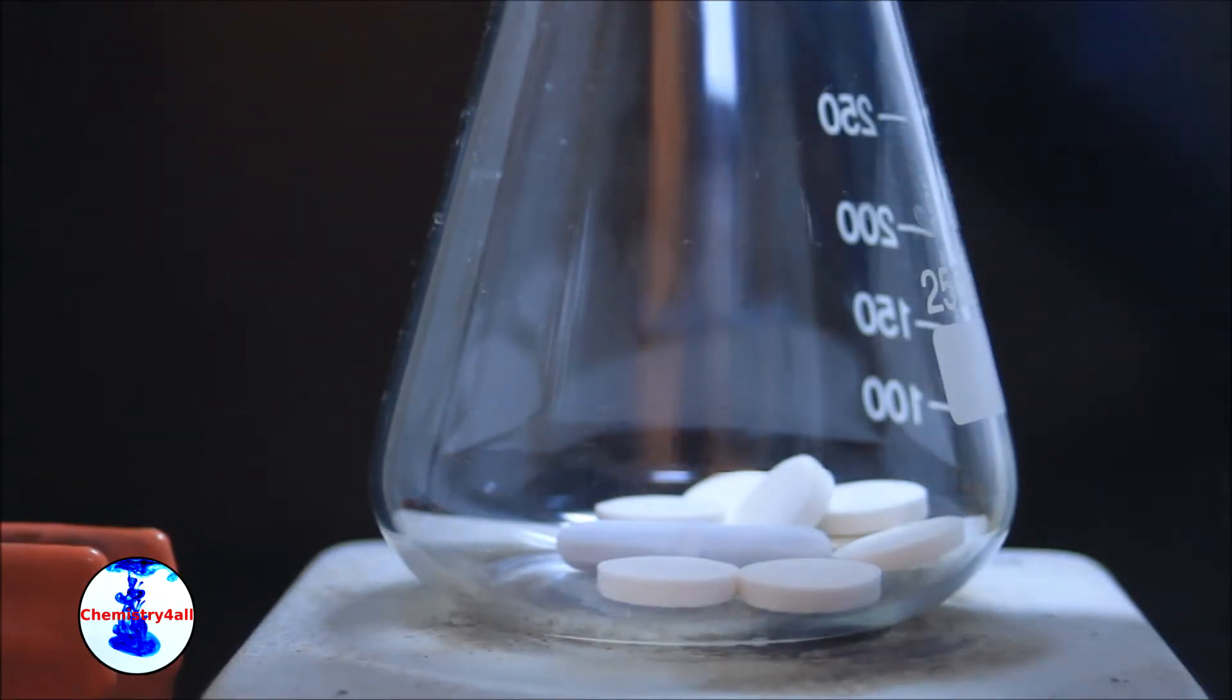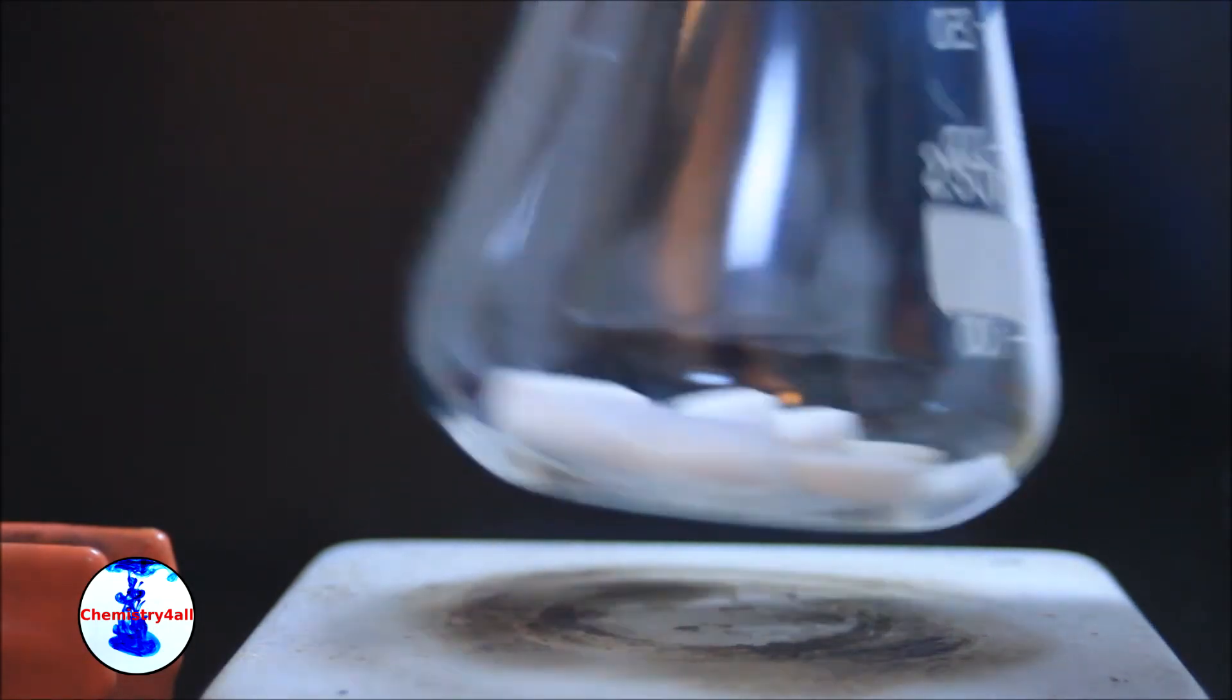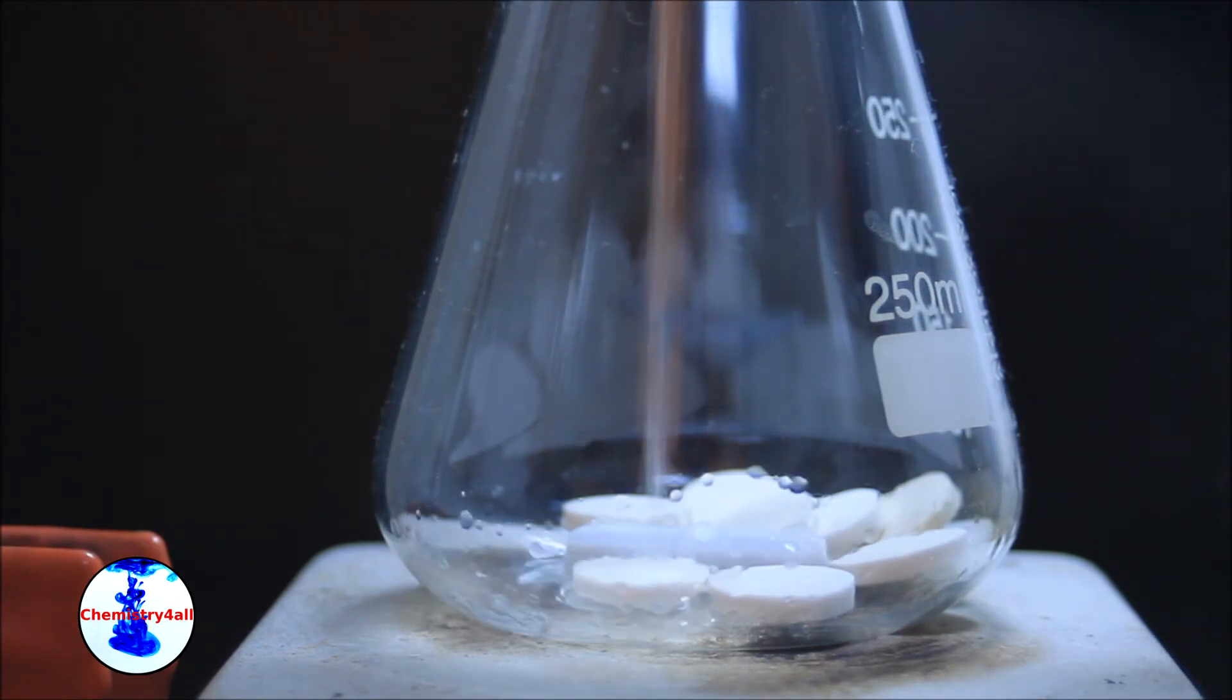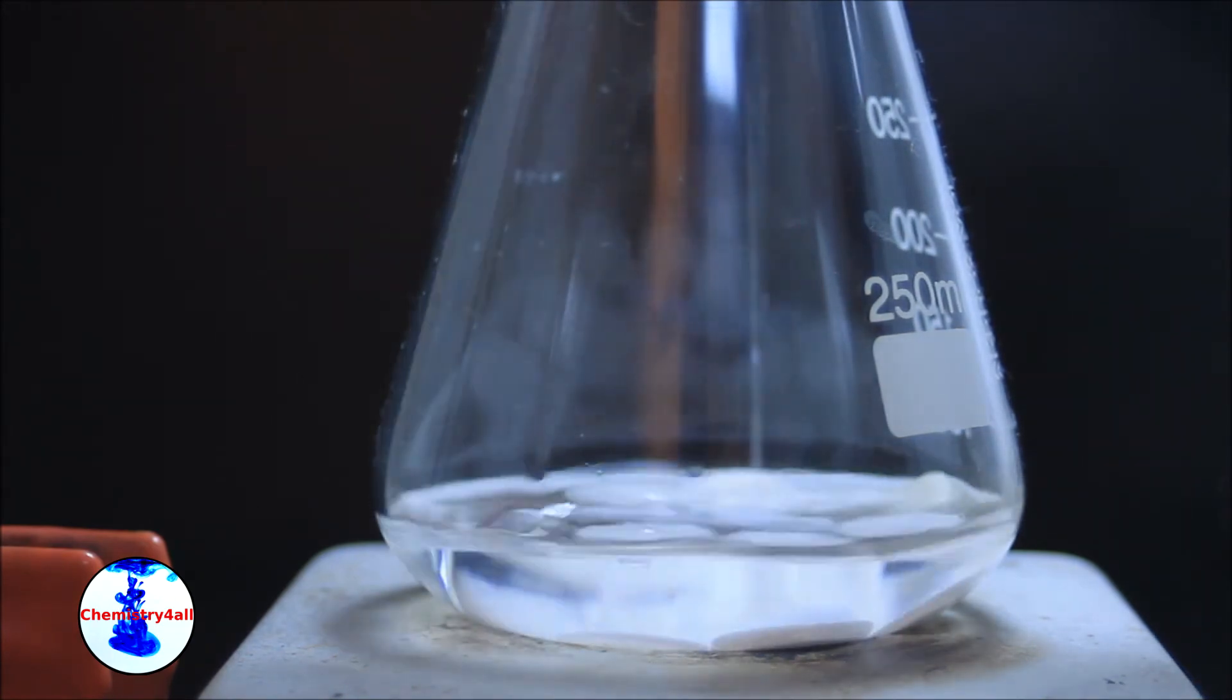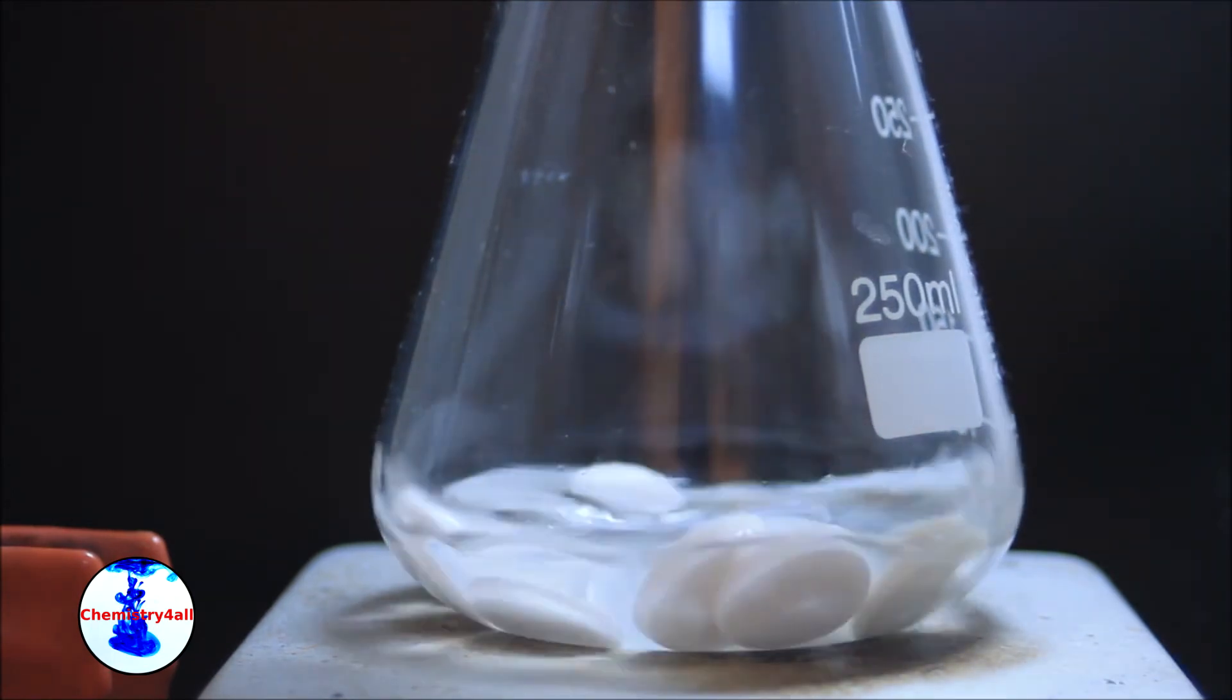In the meantime, I decided to carry out a second extraction using another 17 grams of pills, but this time without crushing them. At the end of the video we will compare both yields to evaluate whether it's worth to crush them or not.